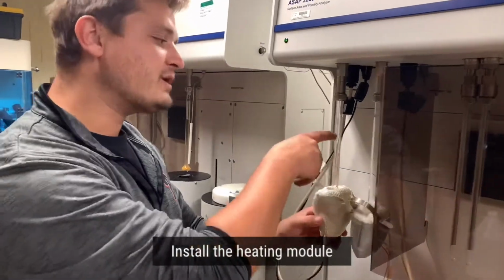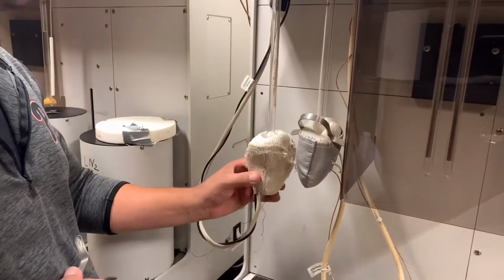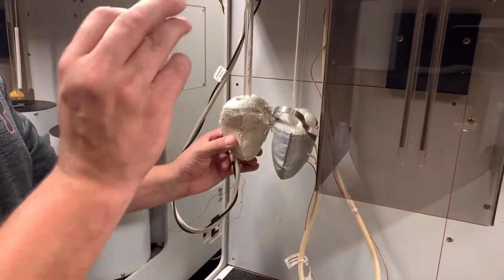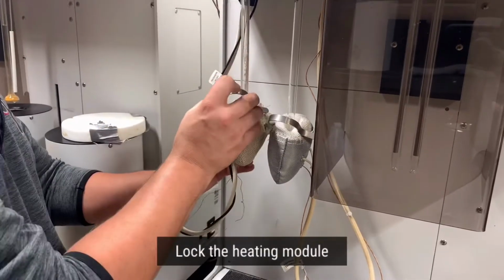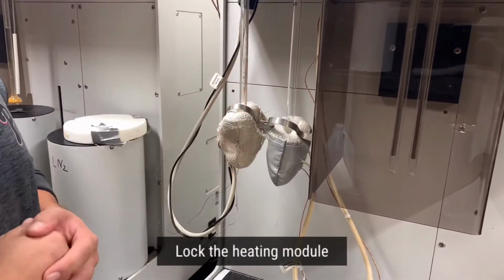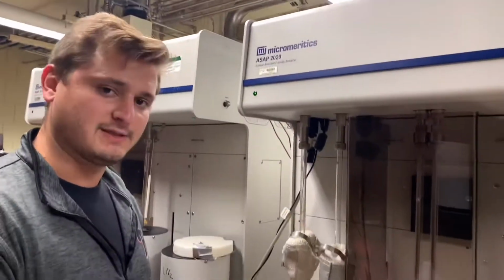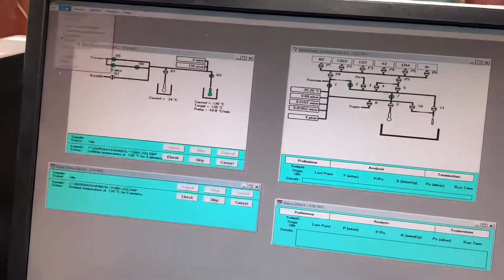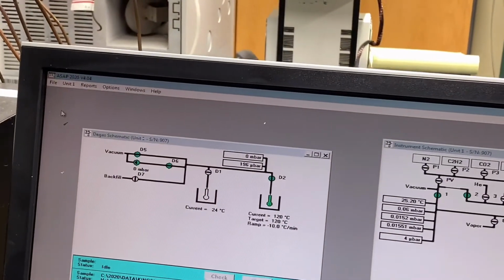We want to make sure we do that without moving the sample tube left or right, and be very careful. So we will put the heating mantle straight up and down, and then use this little lock or holder that will be inserted onto the heating mantle to squeeze it around the sample, so that way it can remain in place. So the next thing that we want to do is now start our sample degas.